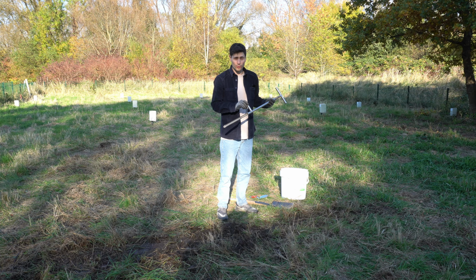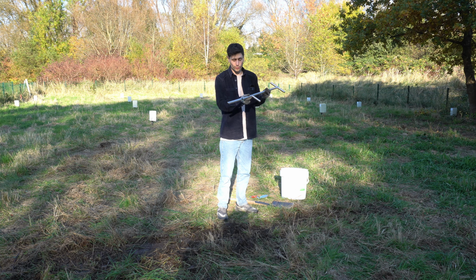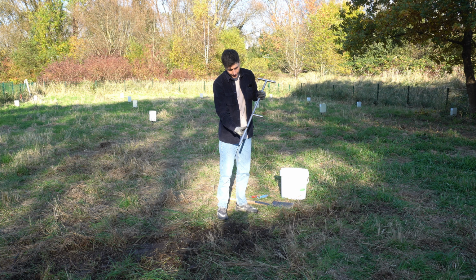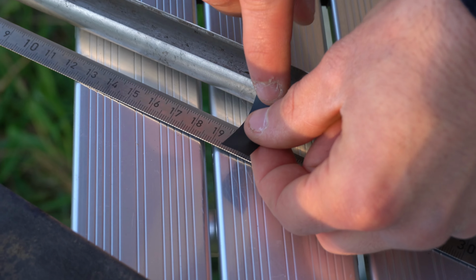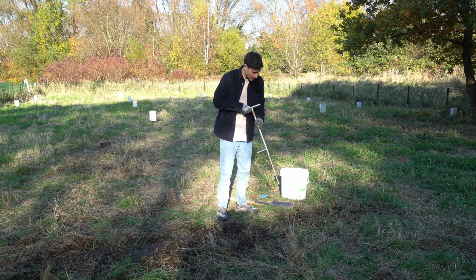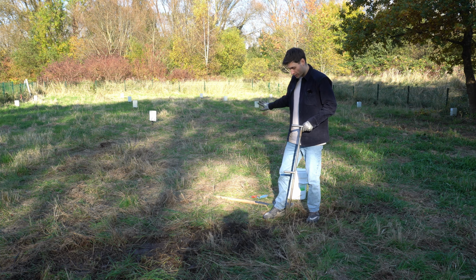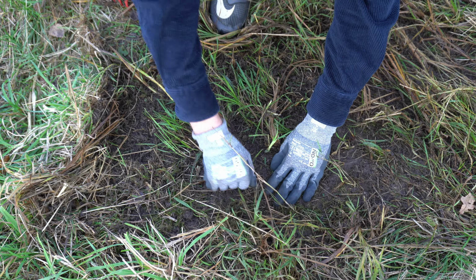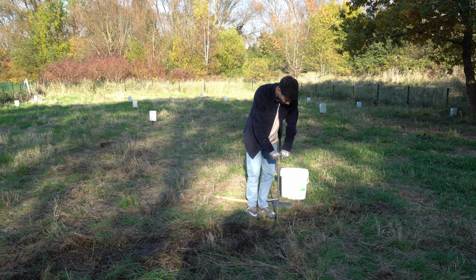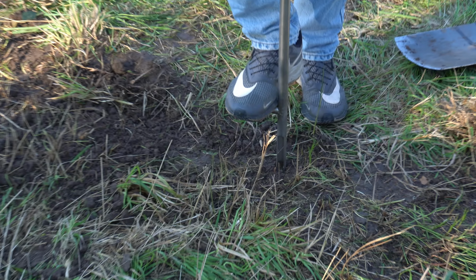Okay, so let's begin with the actual soil sampling. And we begin with the soil probe, and you can see that we marked here the 20 centimeters to which we want to sample today. It just makes it a bit easier when pushing in the soil probe. And what you can also see is that the field we are sampling today is quite overgrown, so we just removed a little bit of grass and the top litter to then actually use the soil probe here, which is quite straightforward. You really just need to push it in, and then the footstep comes in very useful.